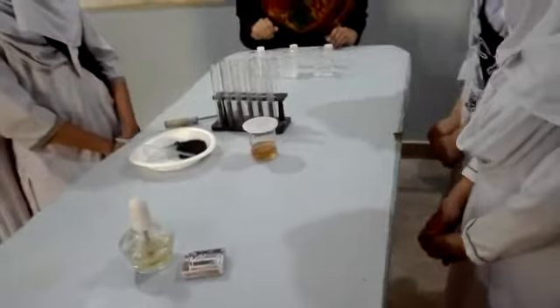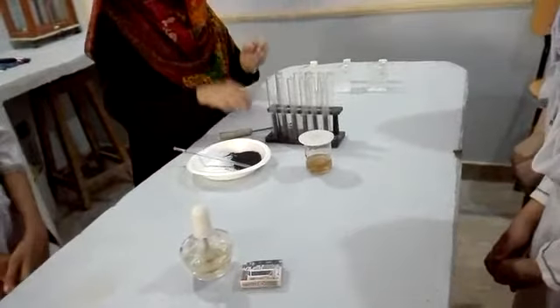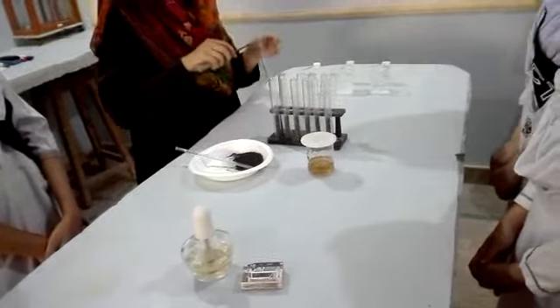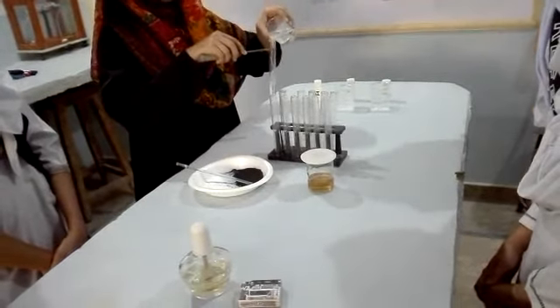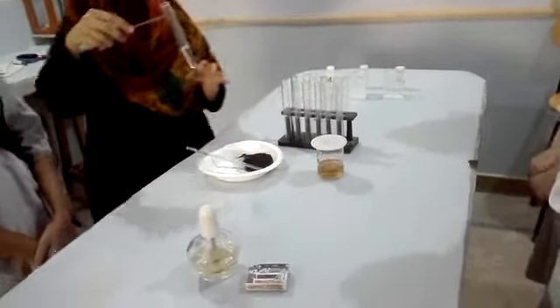How are we going to do this? First, we have to take the first solution and take this test tube. Hold it in a test tube holder, then pour some quantity of solution inside. If you think that it is enough, that's fine. Now, what you are going to do is add some quantity of MnO2 in it.